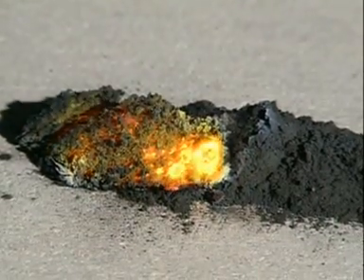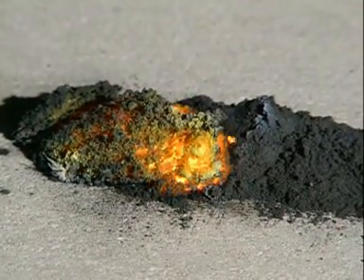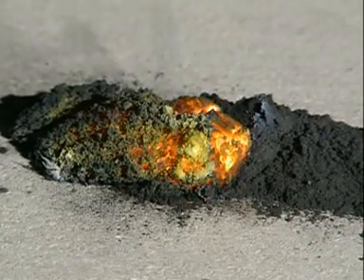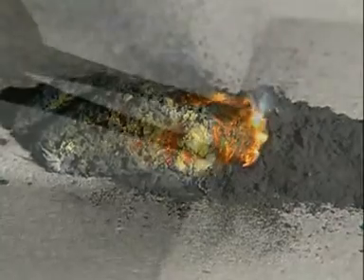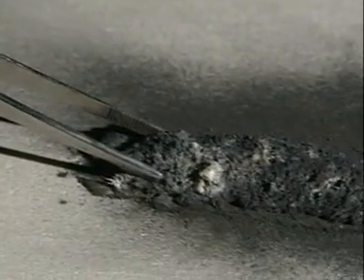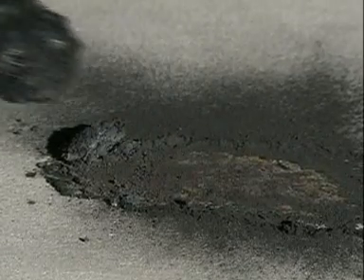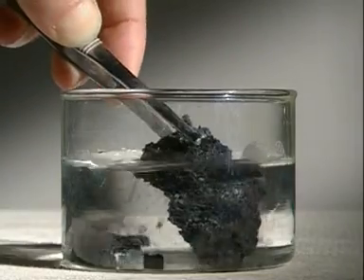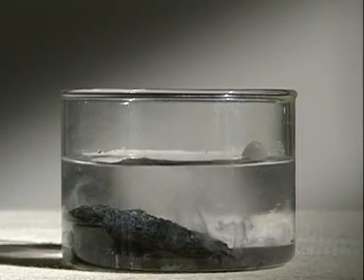Zinc is reacting to form zinc oxide, which is yellow when hot. But what else has formed? Place the remaining solid in dilute acid and after a few minutes you can see pure copper.